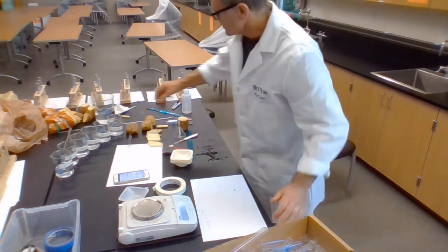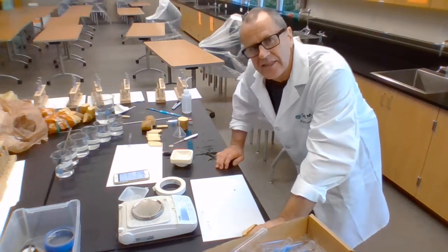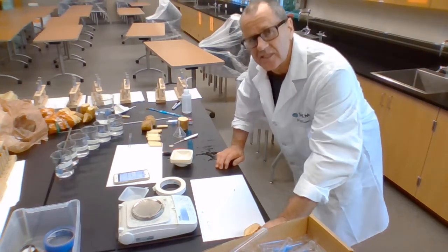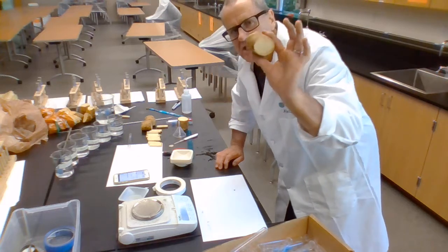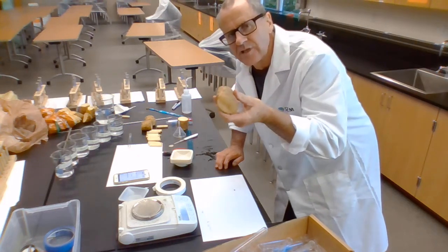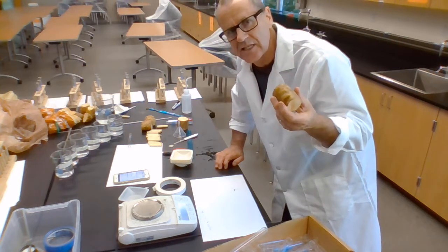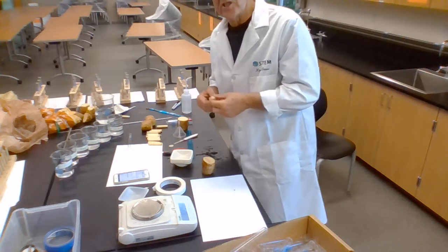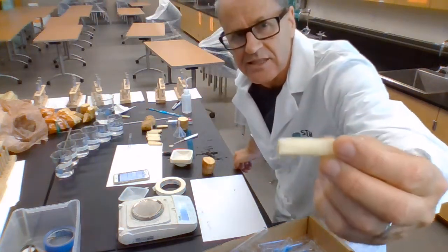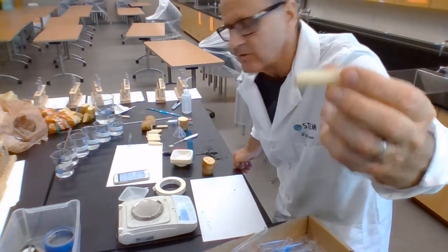And the easiest cells to use for me are probably potatoes, although you could use anything. But the reason I use potatoes is because they're really evenly packed. And in this starchy solution here, they're all pretty uniform. There is a pretty homogeneous sort of surface there. But I need also some very homogeneous sort of units of these cells in order to control my variables.